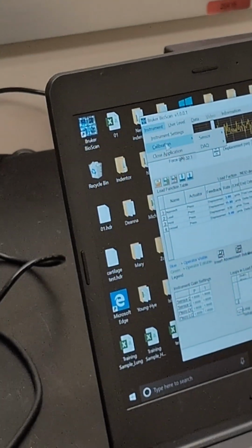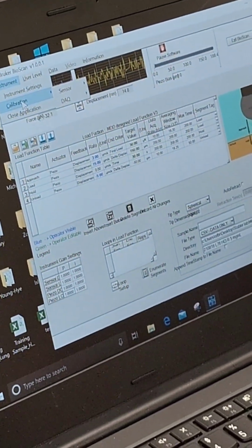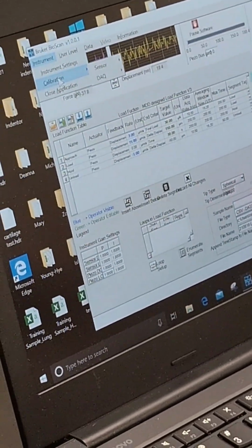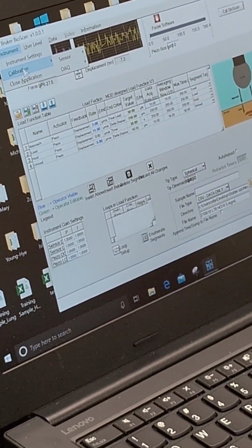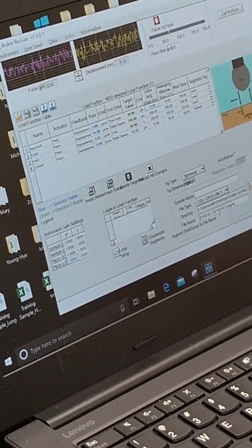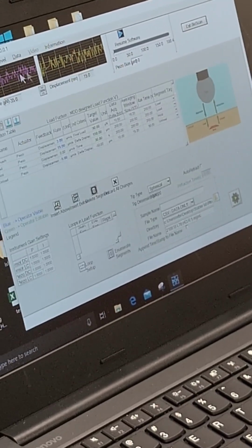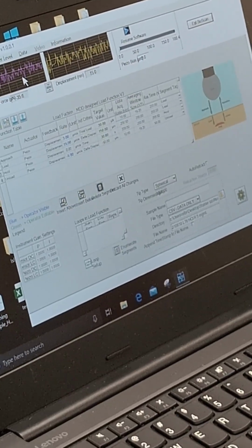That will actually get to the calibration part of it. So basically, it says start off from the beginning. Basically, it just starts off from the computer. If you have already started up and you want to change the probe type, for example, change to a different probe type after you're done with this, it's highly recommended you pause the software first. That means it doesn't record any kind of force.